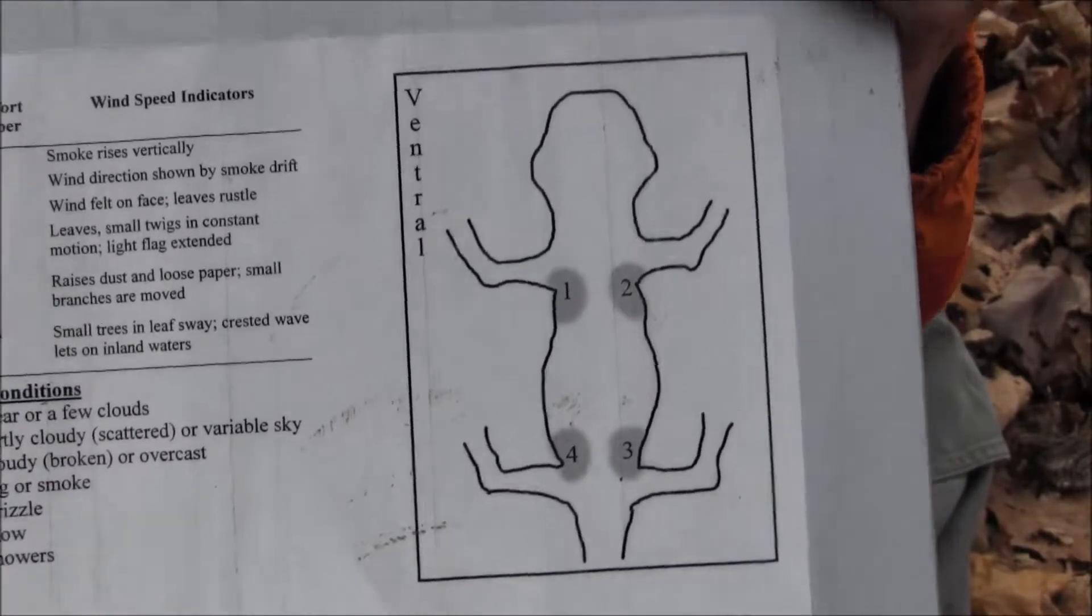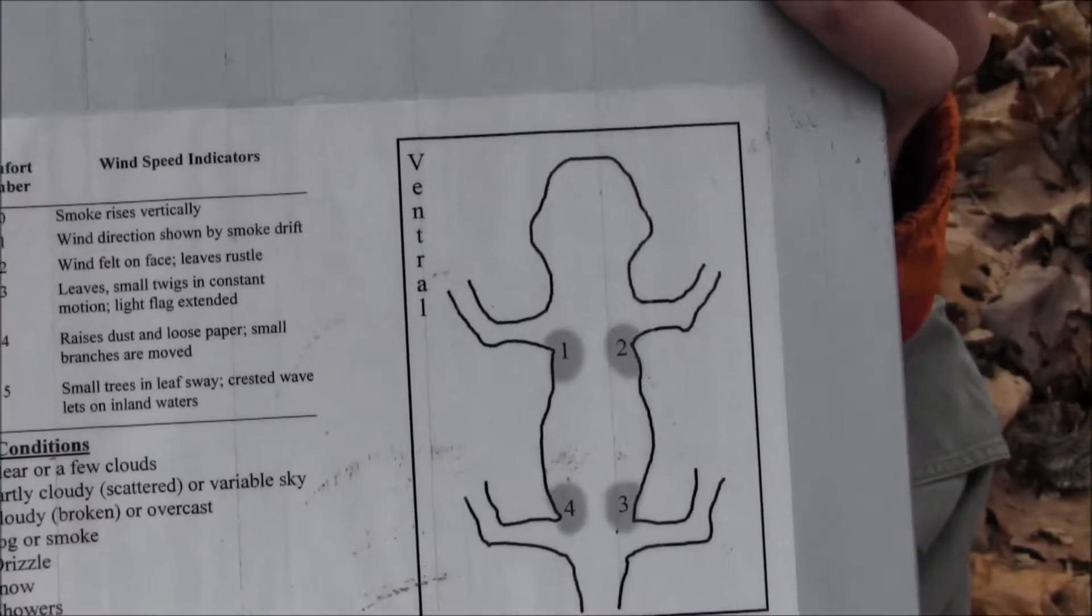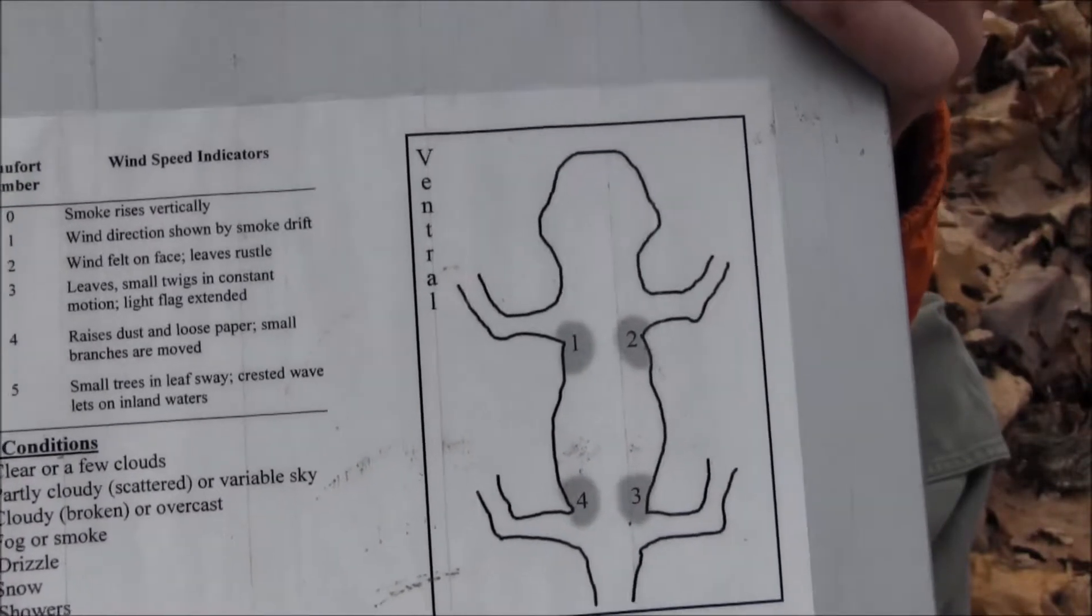And in this study, we've got five different colors. Well, really four different colors, but one of those is no mark, and we've got red, yellow, orange, and blue.